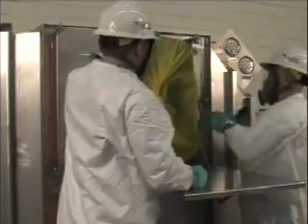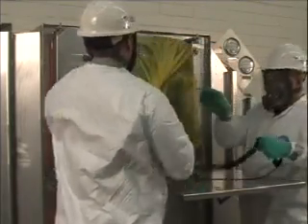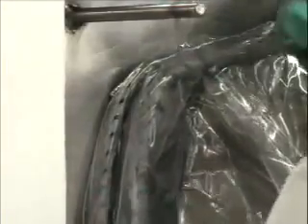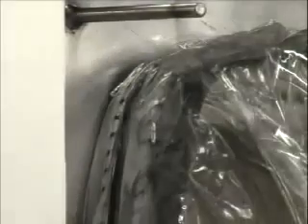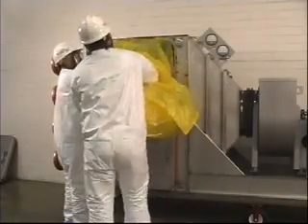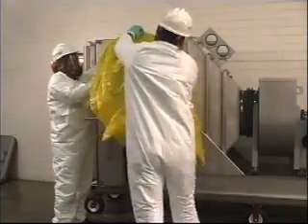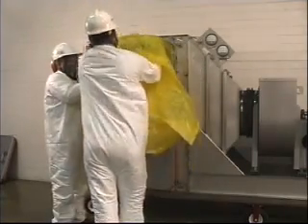Remove the change-out bag security strap, leaving the stub bag on the bagging ring of the housing. Move the stub bag shock cord in between the 2 raised ribs on the bagging ring. If there is more than one filter to remove from the housing, place a new change-out bag around the bagging ring. Locate the shock cord between the housing and second raised rib of the bagging ring, with the seam of the bag located on top of the bagging ring. Remove the stub bag from the bagging ring, pulling it to the back of the new change-out bag. Reinstall the security strap around the new change-out bag.